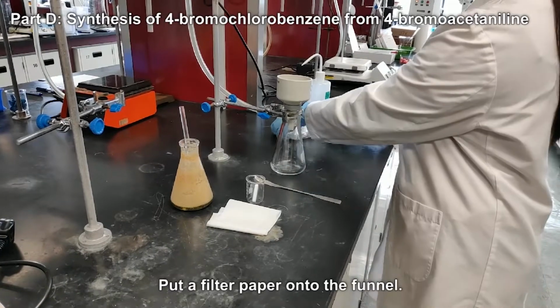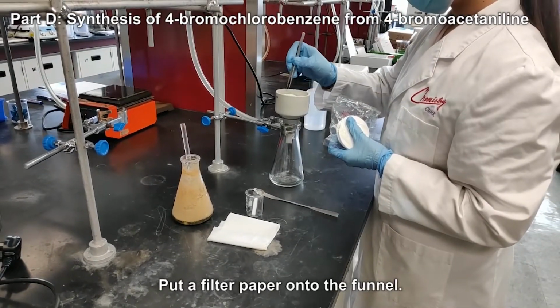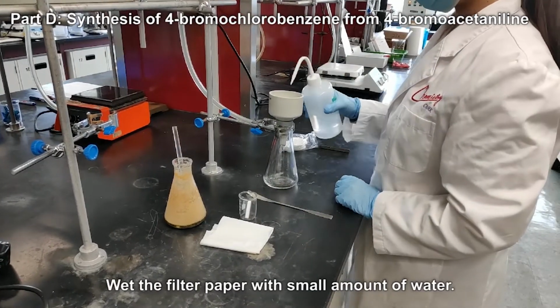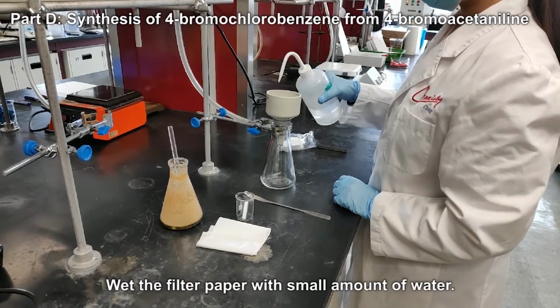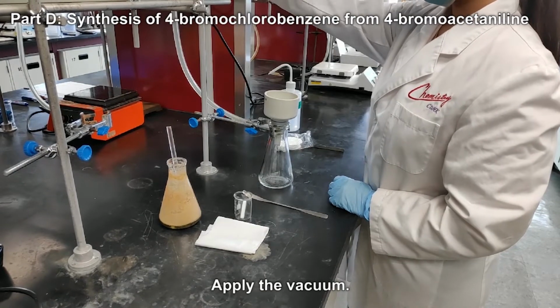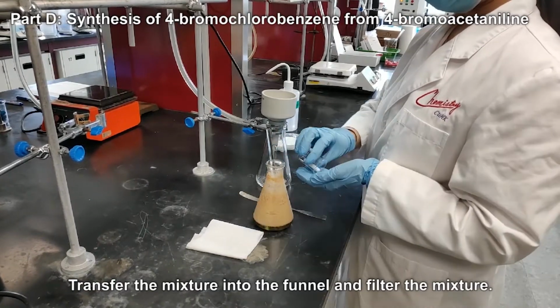Put a filter paper onto the funnel. Wet the filter paper with a small amount of water. Apply the vacuum. Transfer the mixture into the funnel and filter the mixture.